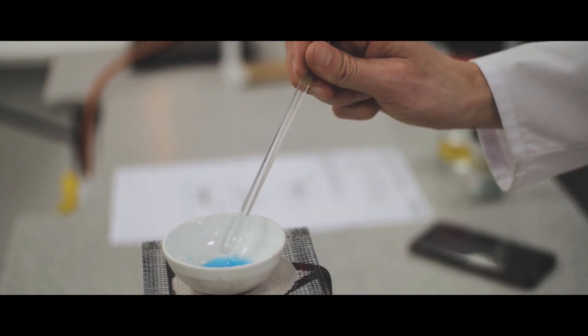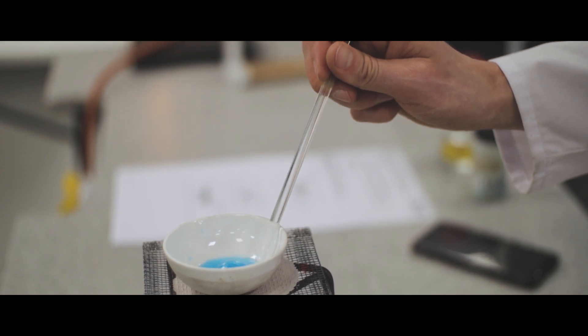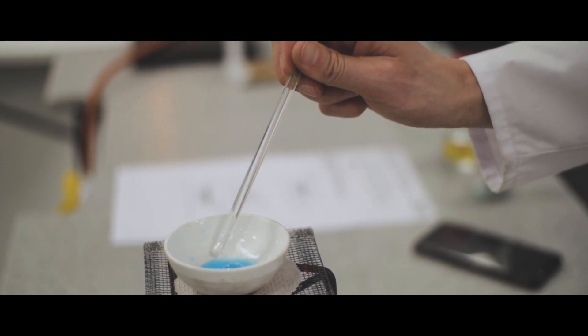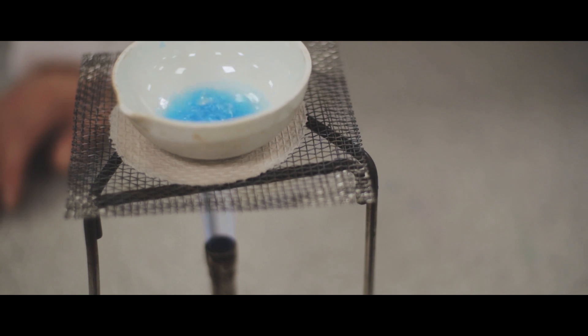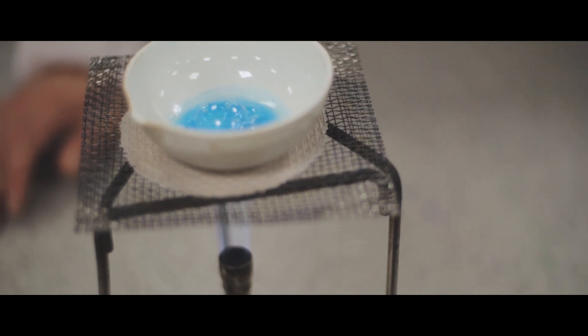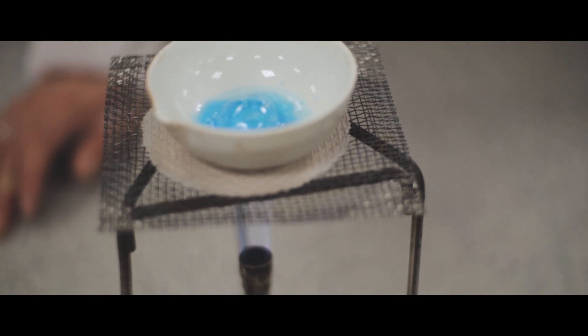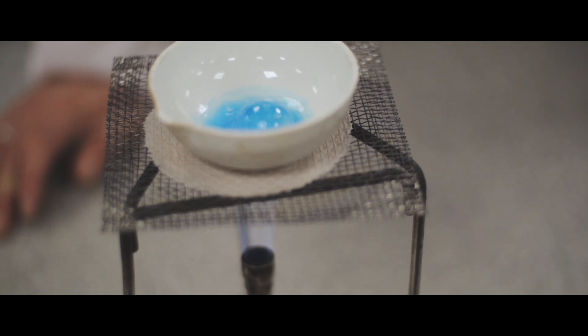So we can see evaporation taking place. The water has been evaporated and the liquid that's left behind will become more and more concentrated. So we should see a more deep blue colour.